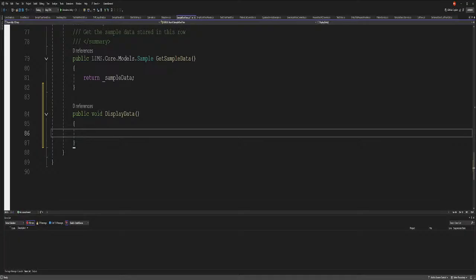This sample window, if you can see it, is supposed to display all the data, right? So let's just look on here and make sure that it has no conflicting data. All right, great. There's no conflicting data. Now there are several issues. One is if you set this to inactive, it's not gonna open up when we want it to.